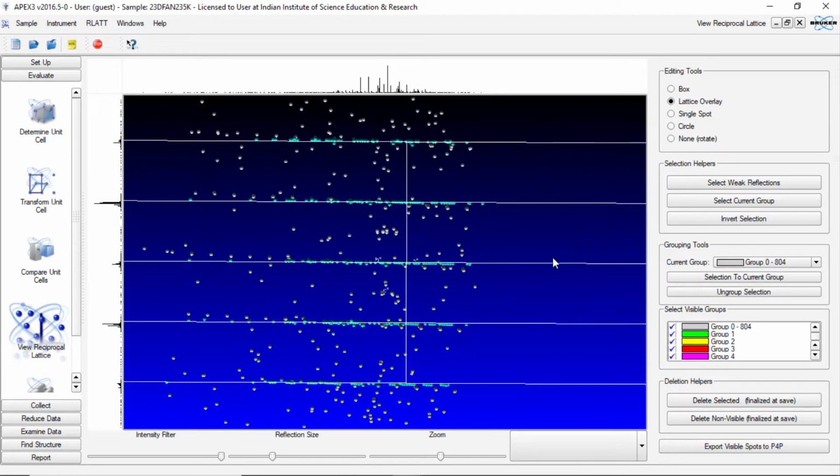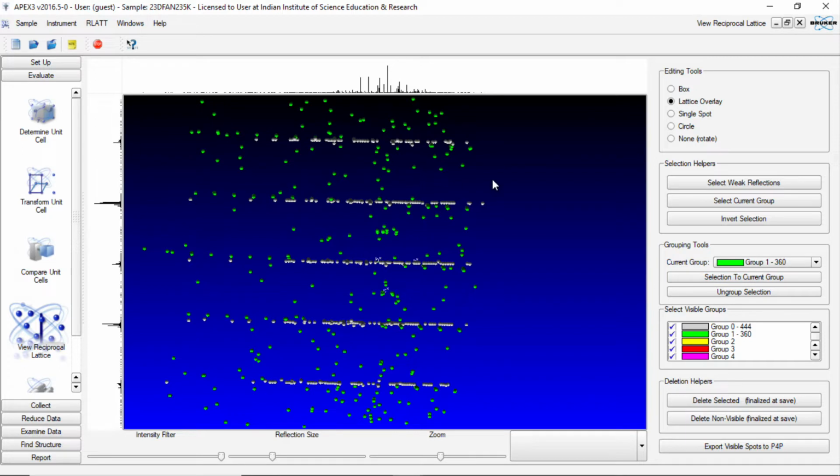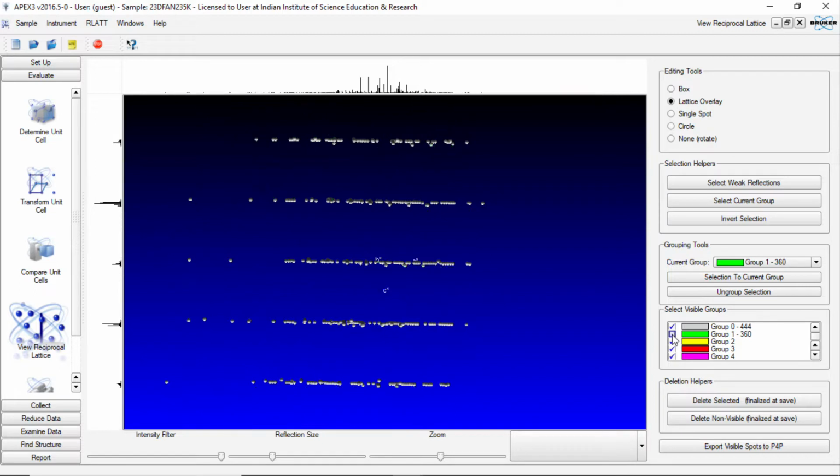Now if we release the mouse button, these are selected. I want those reflections to stay and others to disappear. So we do invert selection. Now the selected ones are deselected and the deselected ones are selected. Then we change the group to green and say send selected reflections to current group. So those reflections which were selected are now in green. Now if we untick this, the green reflections which are totally out of the way are removed.